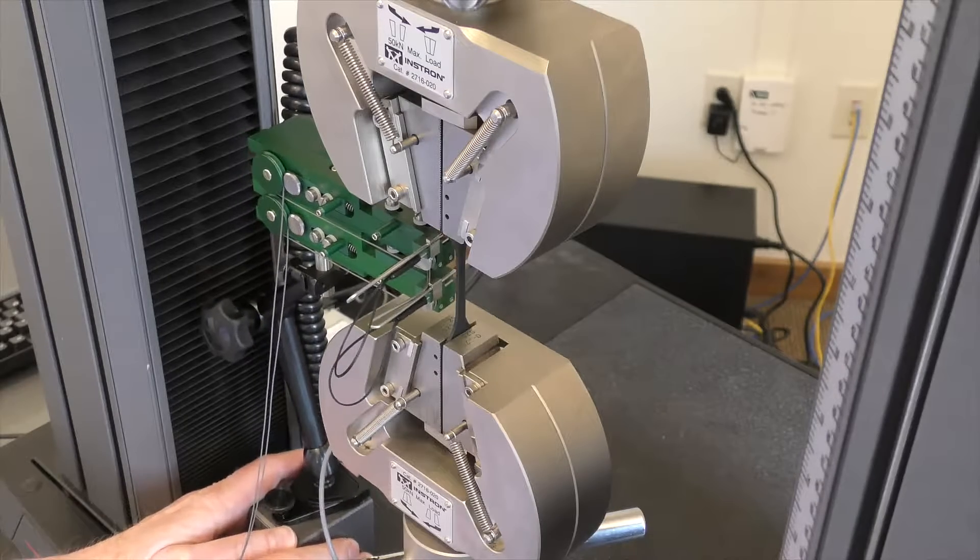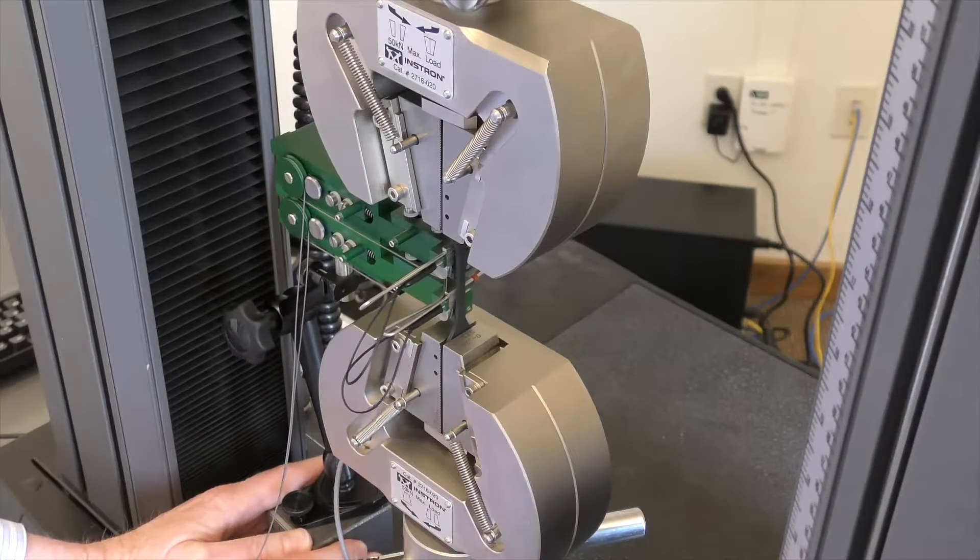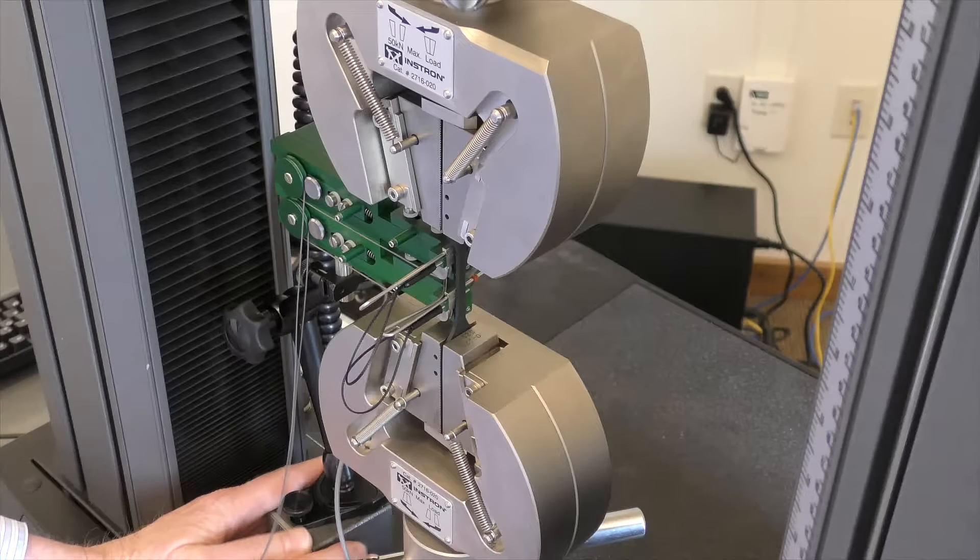With the zero pins in place and the sliding positioners pushed towards the traveling heads, move the magnetic base so that the extensometer's traveling heads contact the specimen.